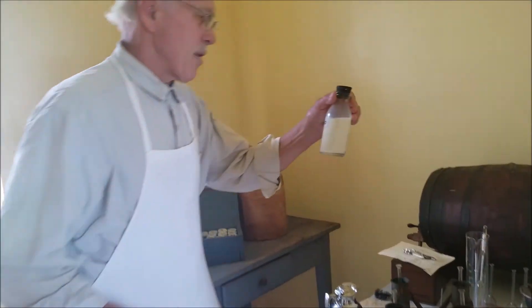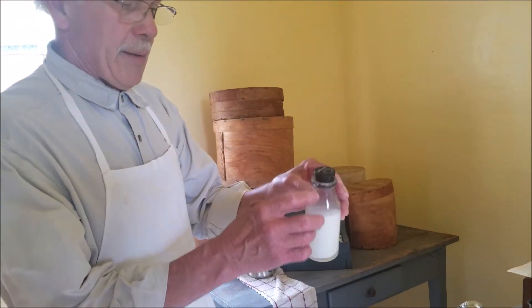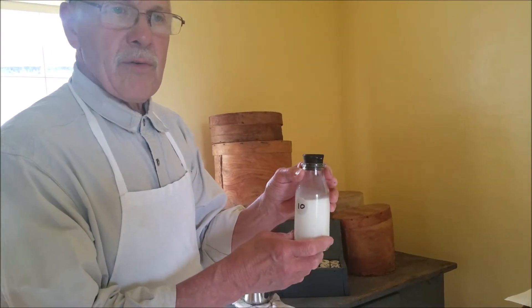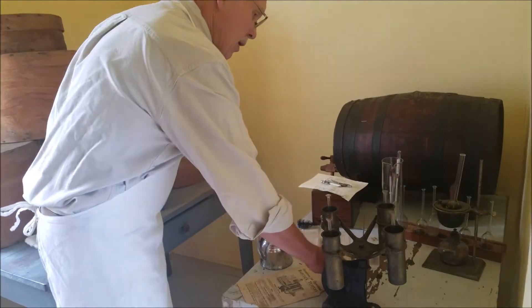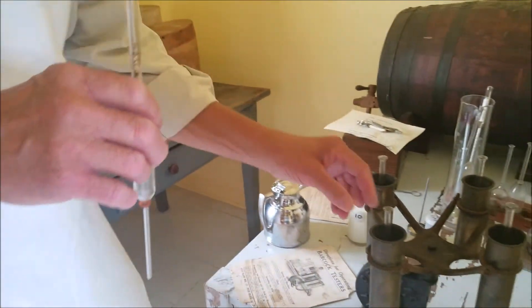What I have here is the milk I just sampled. I have number 10 on the bottle and number 10 on the cap so nothing can be mixed up. The 10 goes on the ledger of my book for the farmer. Everybody gets a number. So we're going to start our measurements of milk and a reagent.